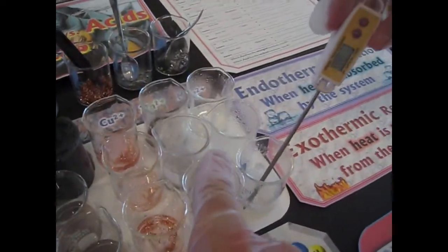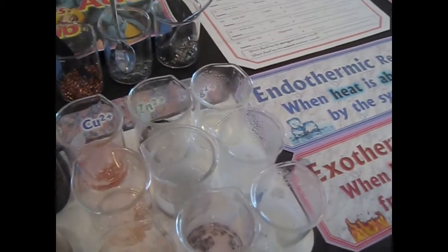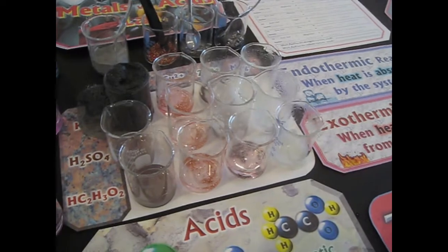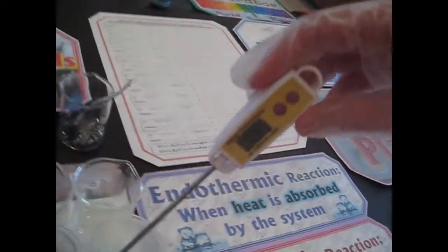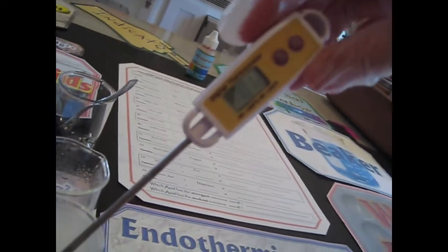Yeah, so now go to this one. Well, acetate has a vinegar smell. Measure the temperature of these other ones. Yeah, wipe it off in between. We should have gotten it while the reaction was full blown, but we should still be able to tell whether it went up or down by whatever temperature it is now. What is that one? 70.1. Try the next one. Wipe it off. Good technique. Next one. And remember, these might not be the maximum temperatures.